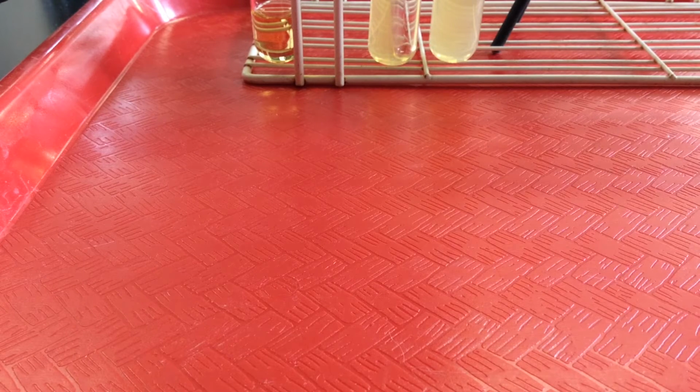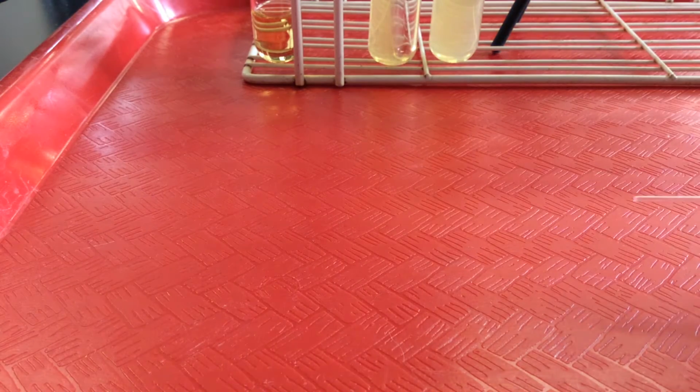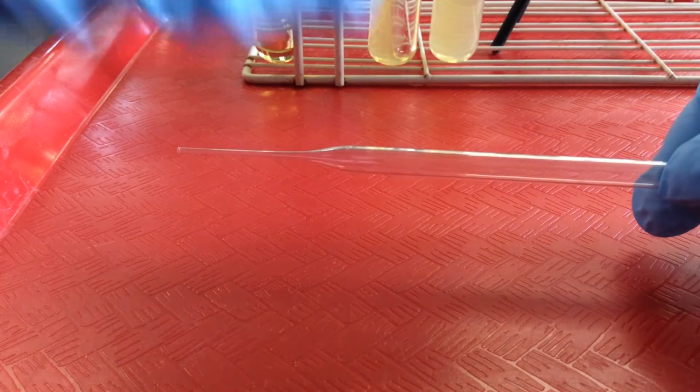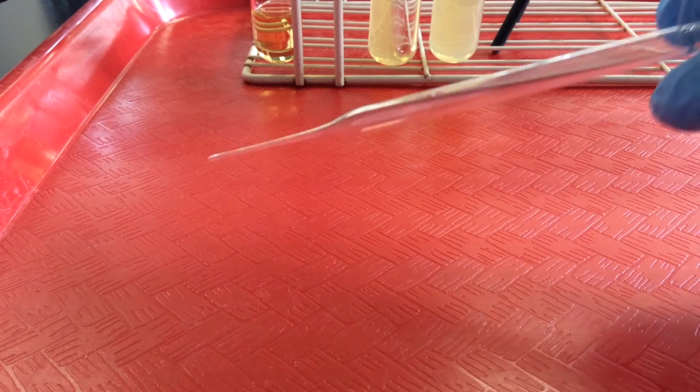Another way to move microbes is through the use of what's called a Pasteur pipette, a glass one, which we have here. Now these aren't marked with units, so this is a less accurate way of transferring fluids. But what we would do is use a plastic bulb, like so. And then we could transfer, say, fluid from a liquid source, either onto an agar plate or into, say, broth.